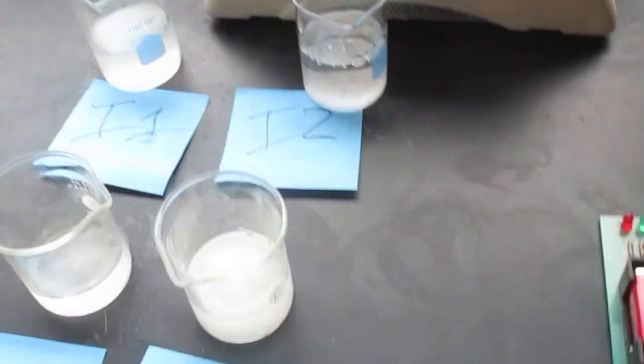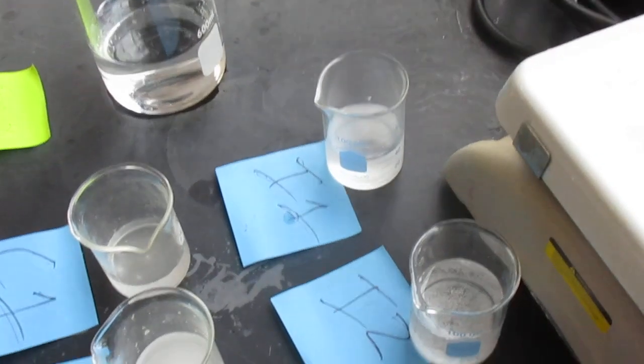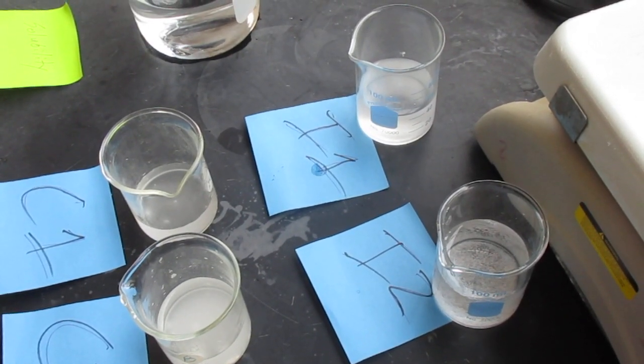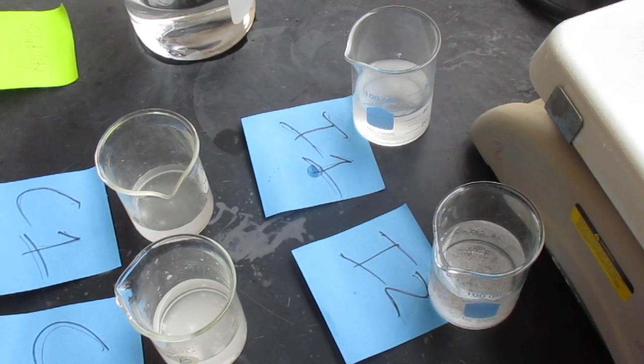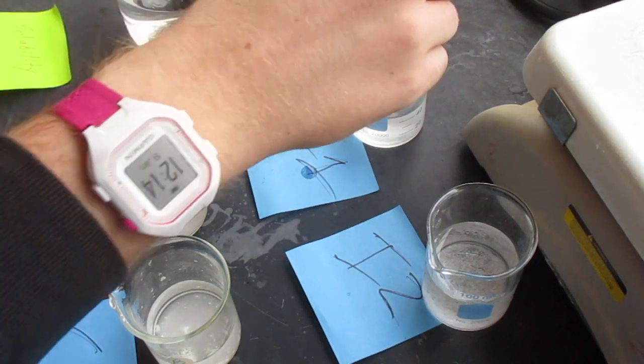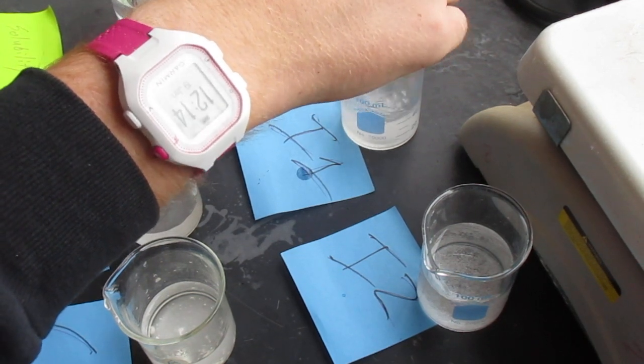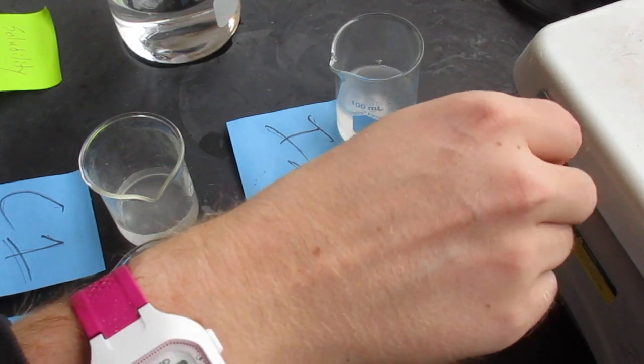And again I apologize, one of the things that I just did is I totally forgot to grab a stirring implement. Ionic one, ionic two.